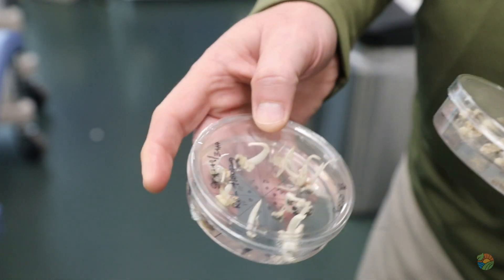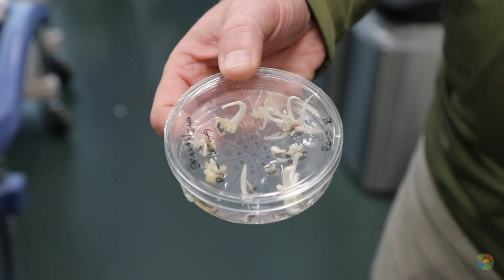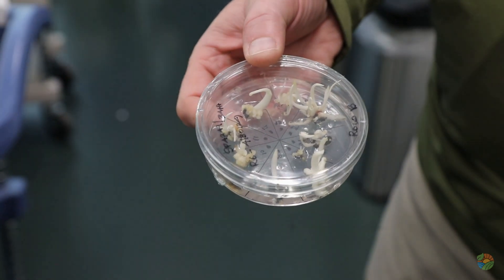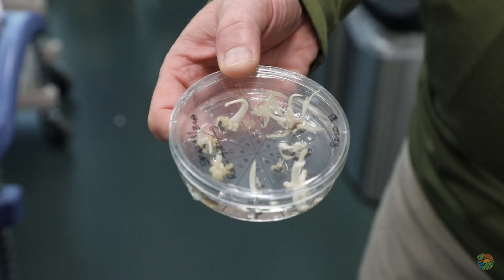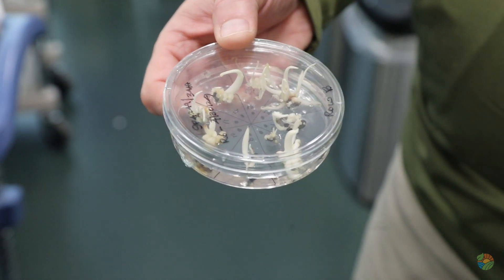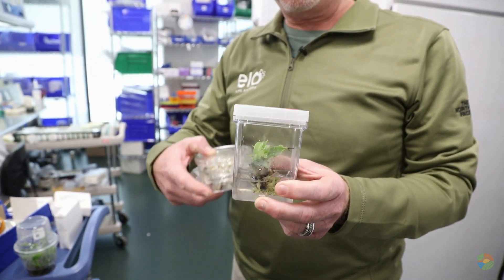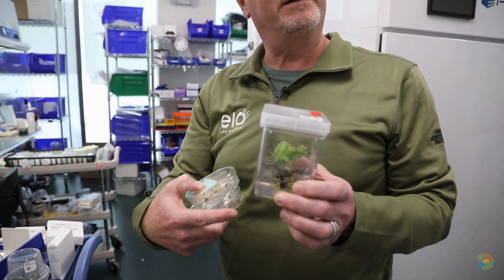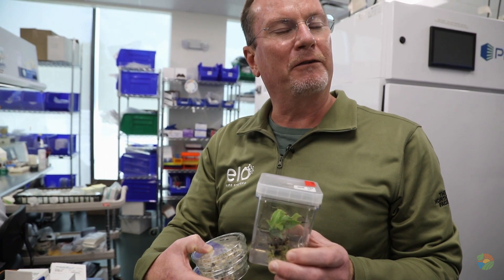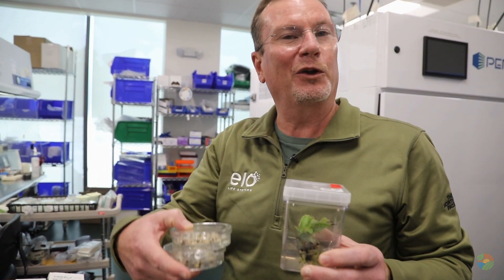What we do is grow those shoots on a special media — it's like baby formula for plants. It gives them everything they need, and then they slowly grow more and more shoots until we can start to move them out into larger containers where they start to look like more regular plants with leaves and roots, and they have the media again — that baby formula for a growing plant.